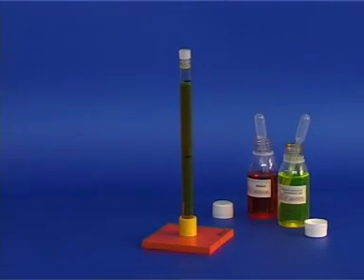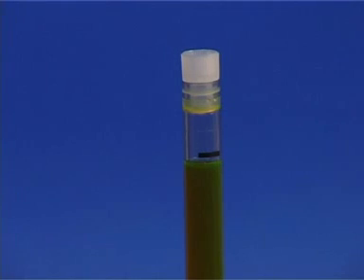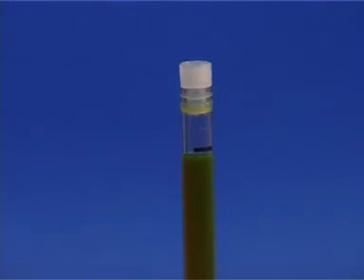Stand the tube on its base and observe the level of the liquid mixture. Why is the total volume now smaller?